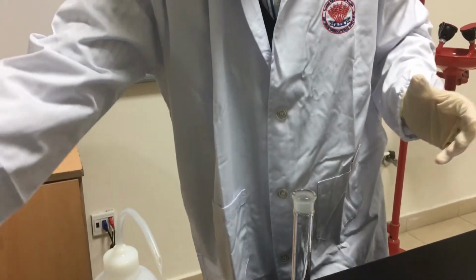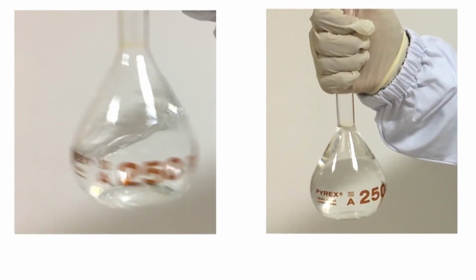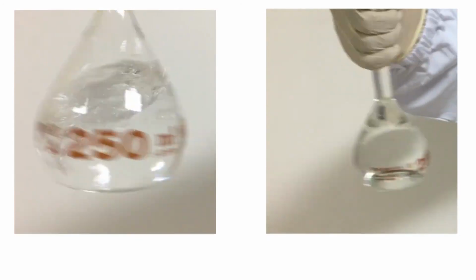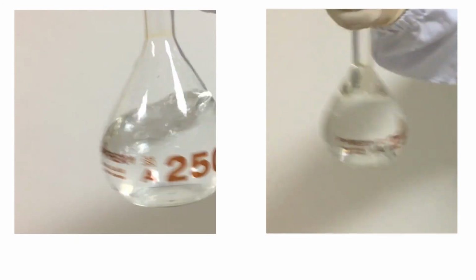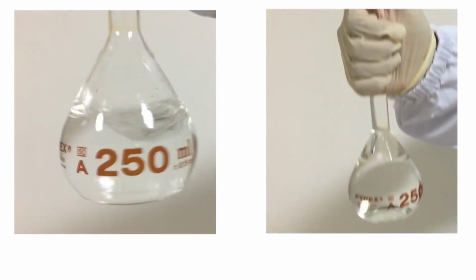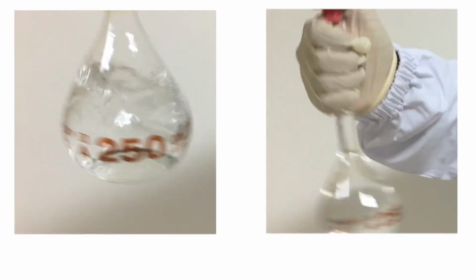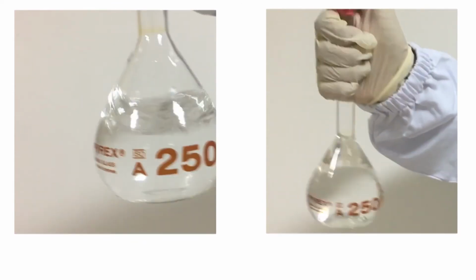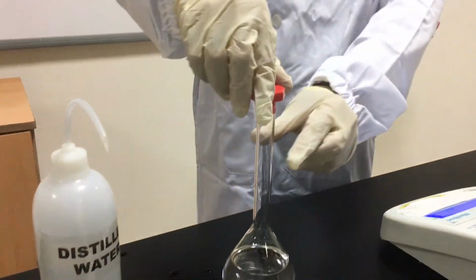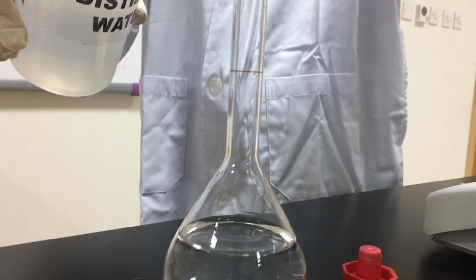Swirl the mixture very well to be sure that the whole quantity of sugar was dissolved. When the volumetric flask is half filled, there's enough space to mix the water and sugar, but if water reached the neck of the volumetric flask, there will be no available space for mixing. Accordingly, part of the sugar won't be dissolved, and will settle down. When you are sure that the whole quantity of sugar is dissolved, add water to reach the neck of the volumetric flask.